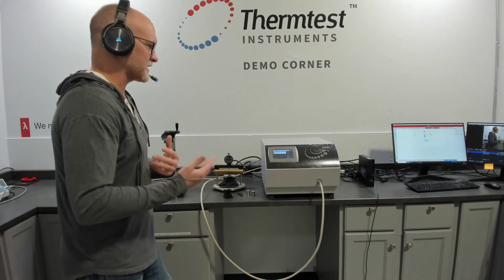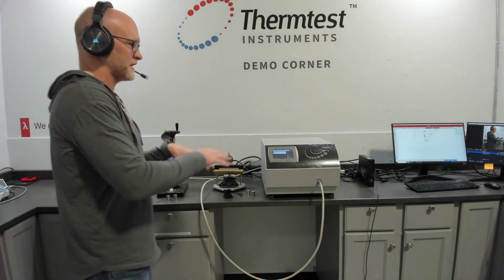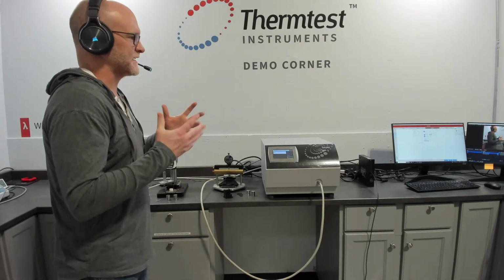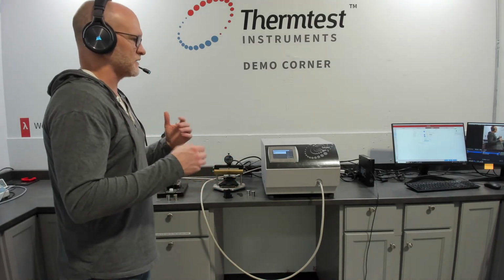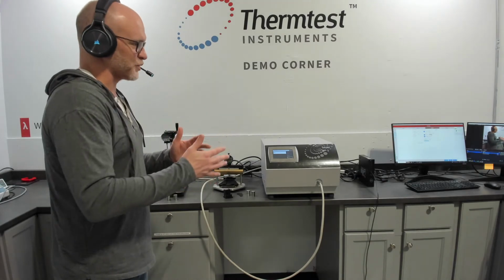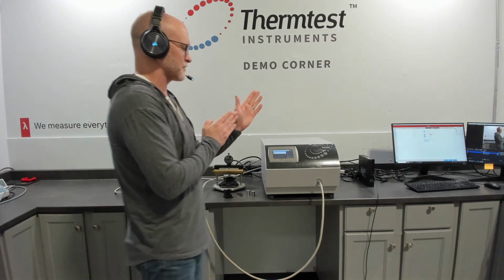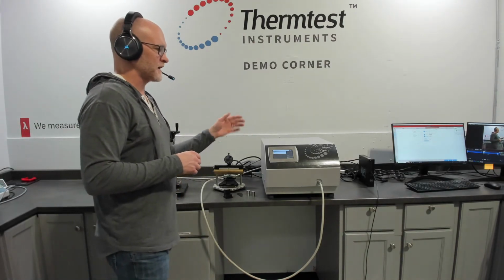So when we were looking at how we evolve the transient plane source method beyond where it's been for the last 15 years, that was one of the key areas. How do we help the users define good data better? Up until this point, you typically would just visually and manually remove those points. By being able to characterize them, you can apply that correction and not have to do that.